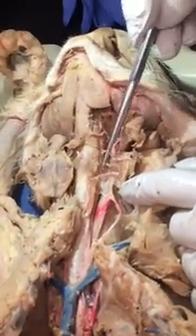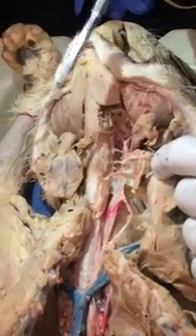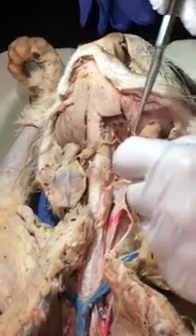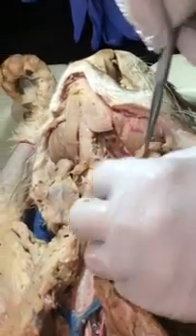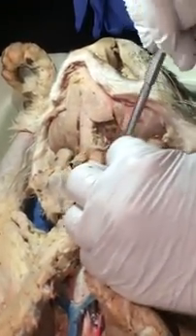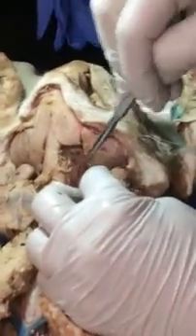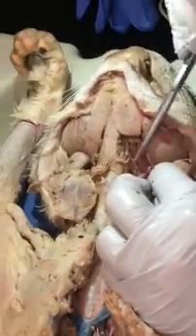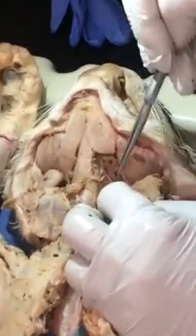Okay, so let me pull and see what I got here. This one's definitely going to the thyroid gland. Superior thyroid artery, you're right. This one's going to the larynx, so this has to be the laryngeal. This one's going to the tongue. Lingual. Okay, it's a bigger cat. Let me just dig in here. Well, you can't put the whole test on one cat, right? I'm just digging just a little bit here. It's been so long since I saw this cat for this position.